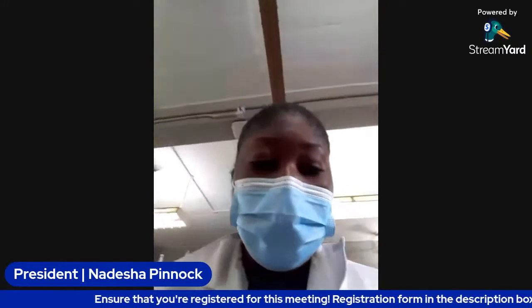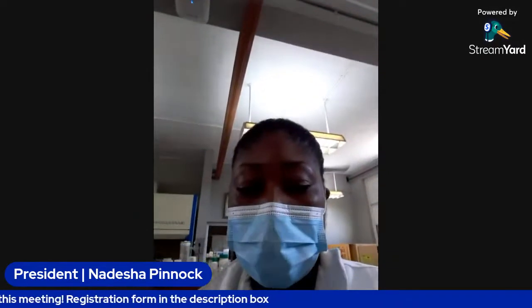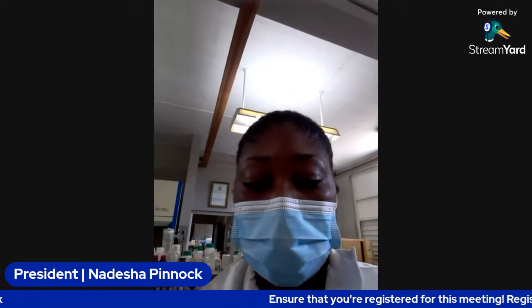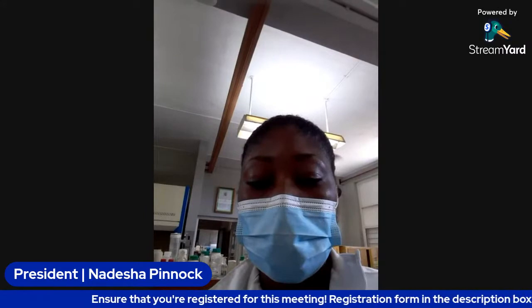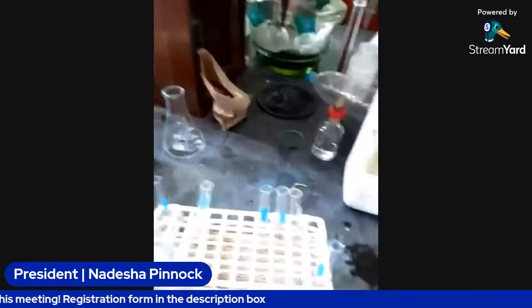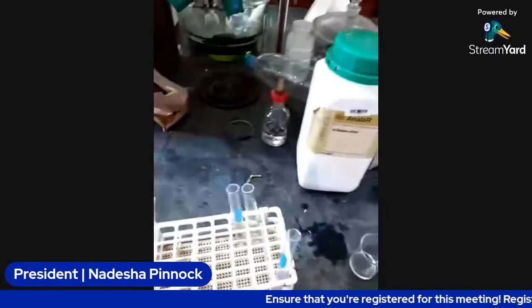So we are currently prepping. So let me just show you guys where we're at the moment. So we're prepping the food samples, adding them to test tubes so that we can carry out the test. So far this is our test tube rack set up with our test tubes, and Tiffany is currently prepping the samples that we need.